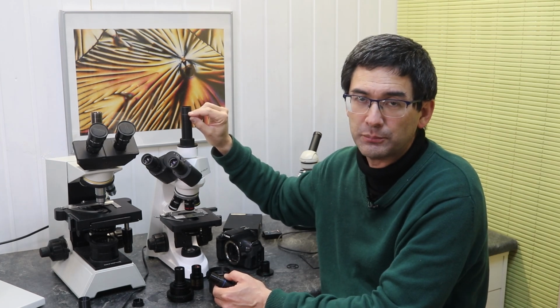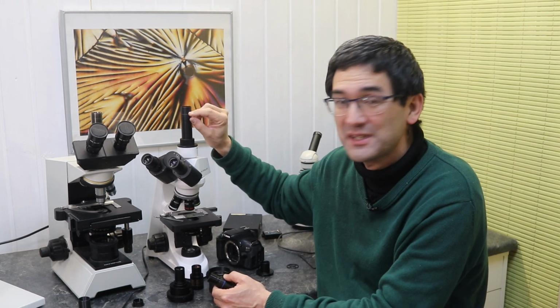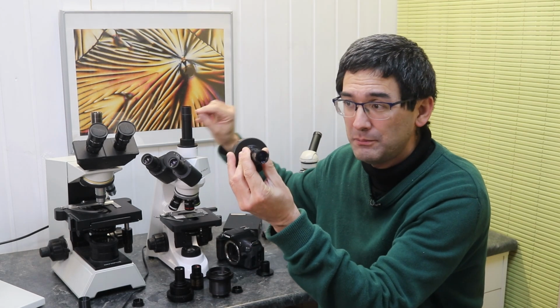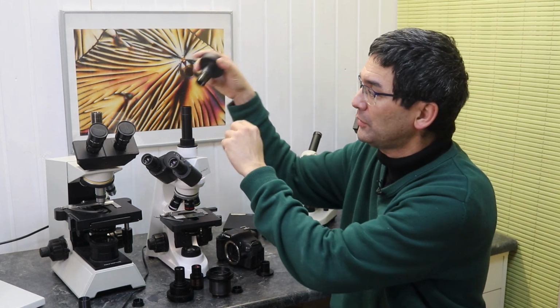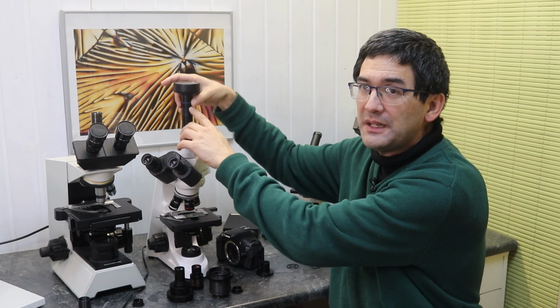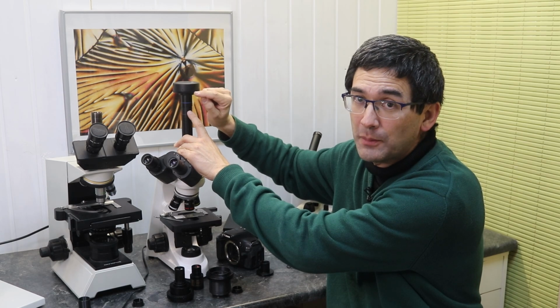So that's the problem. This place is not accessible to the sensor. This is not where the sensor is in this camera, because the sensor is in the body, right? And what the optics will now do, by inserting it in here, is pick up the image and resize it so that it can project it onto the sensor up here.